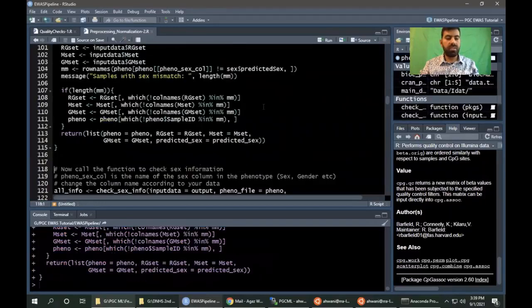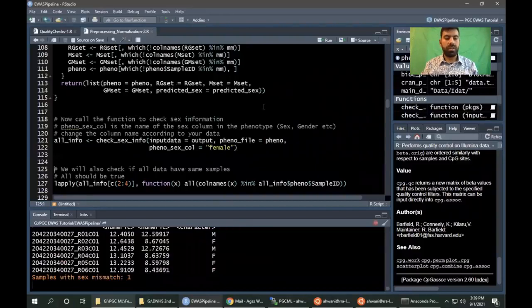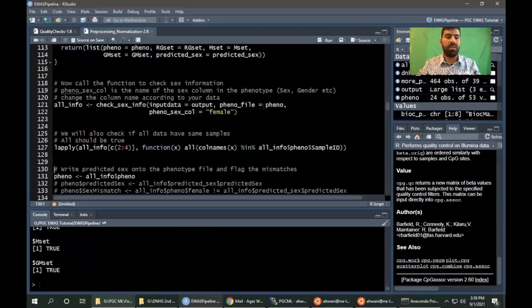Now, in the next step, we will perform sex check. So the data in the phenotype file and methylation data should match. So if there's any sex mismatch between those two files, we need to remove the sample. It means that there's some issue with that sample. So we don't want that sample in the analysis.